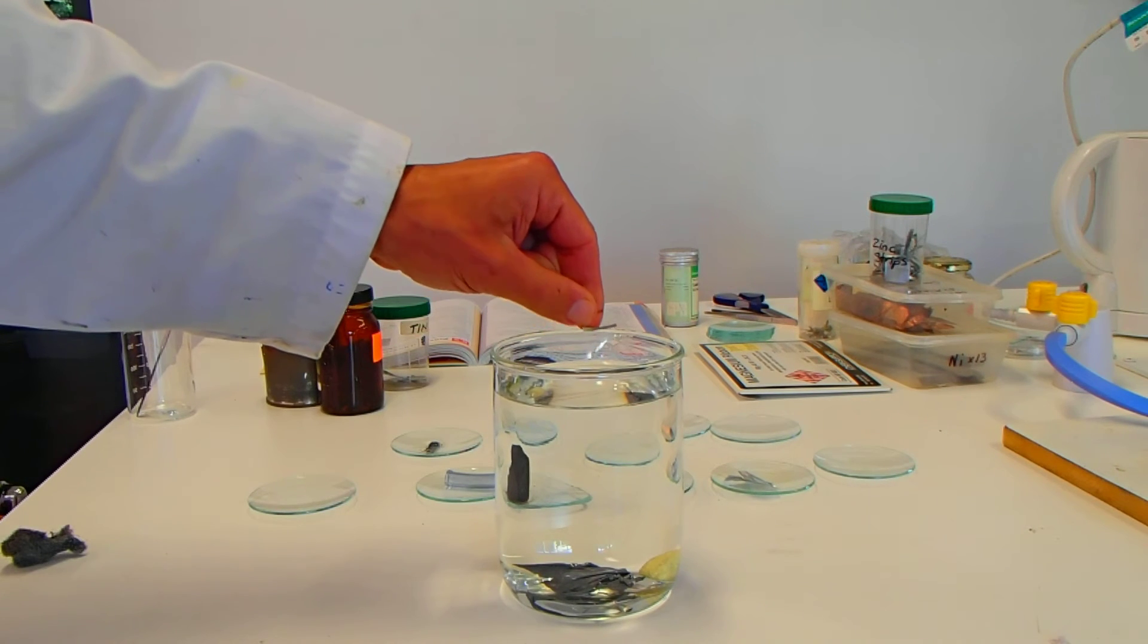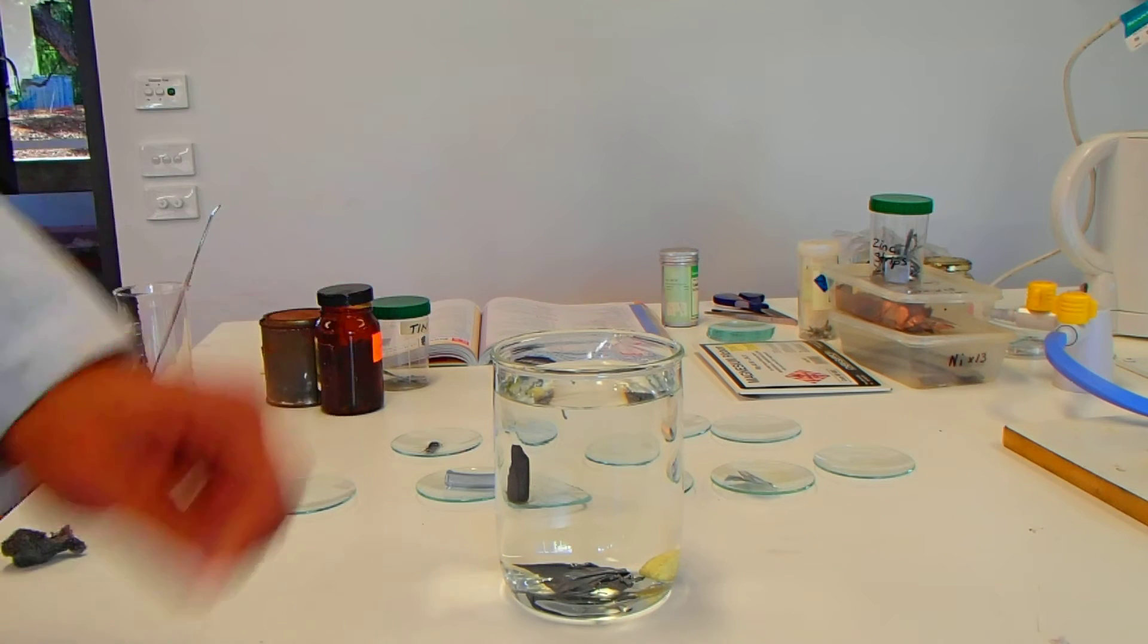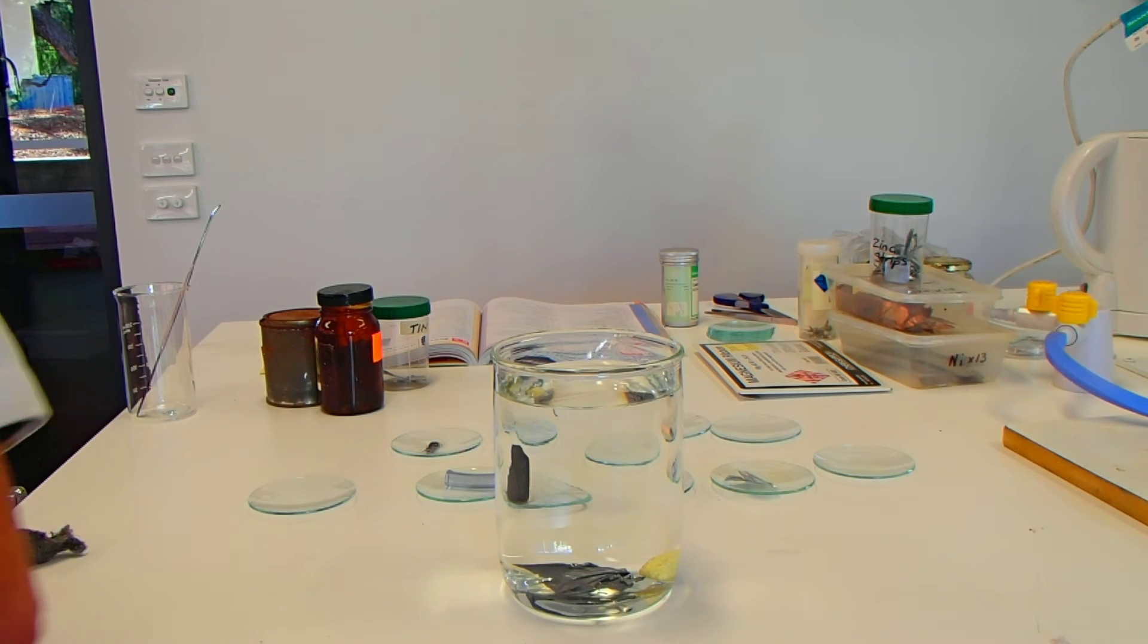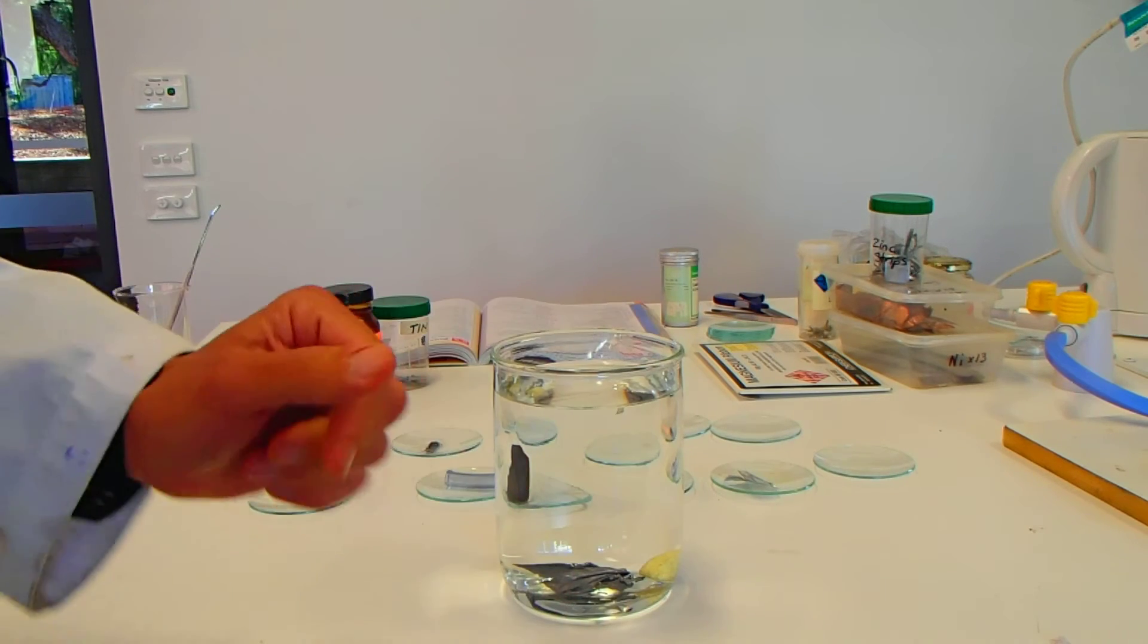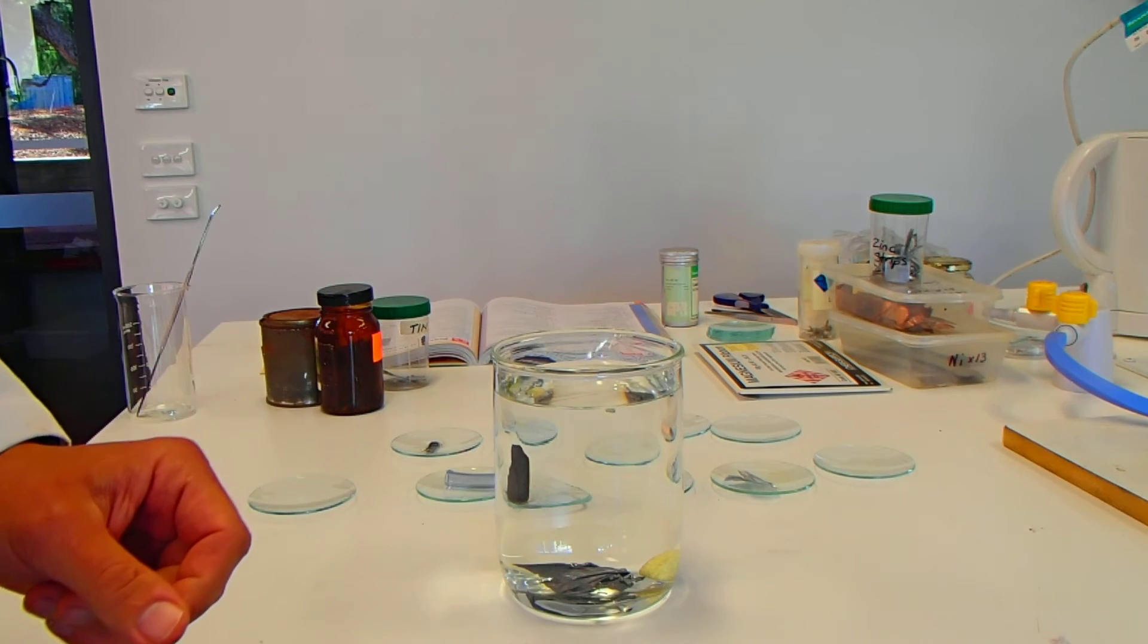The magnesium. Pop it on top. Well, that's interesting. That floats. I'm not sure if you're getting that there in the camera, but that's floating around the surface in a horizontal, vertical sort of way. So, magnesium floating.